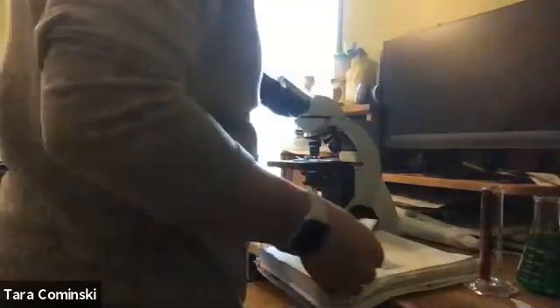Now, it says to get a meter stick. I told you I don't have a meter stick, but that's okay. It tells you 1 meter equals 39.37 inches, okay? So 1 meter is about 1 yard, great, just so you guys kind of know, and I kind of showed you what it looks like.